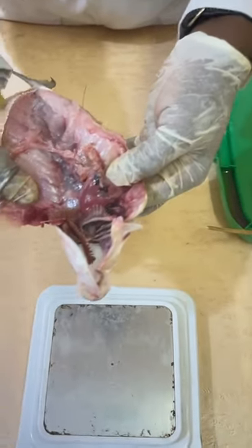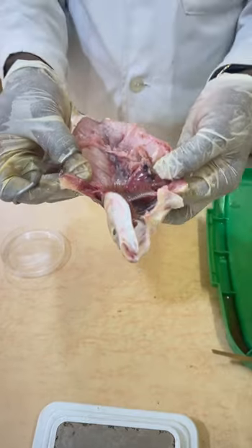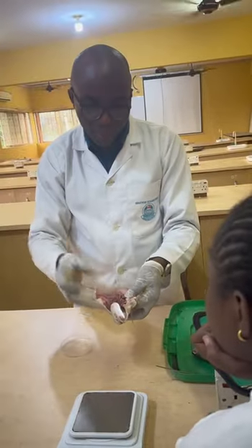You know, we said it in class. At the stage of recovery, it will appear as if it's immature. But really, it's not immature. What happened is that the gonad has passed through one cycle of what? Reproduction, and is recovering and preparing for another.